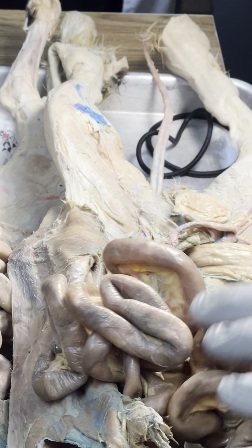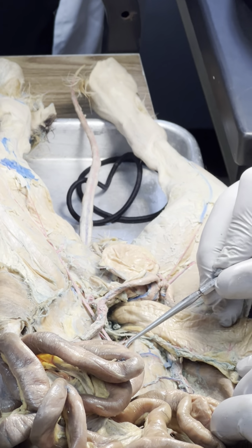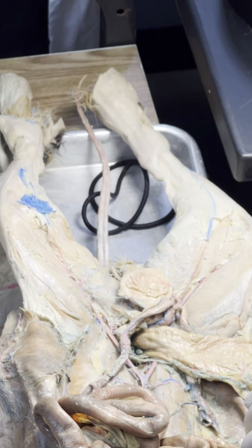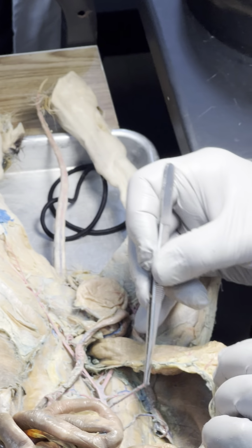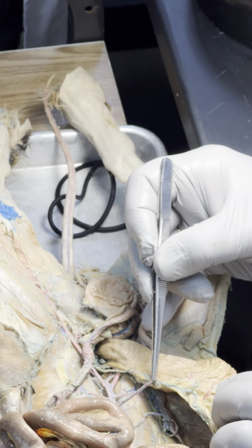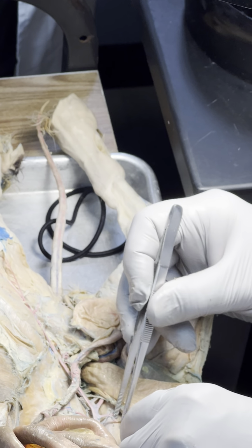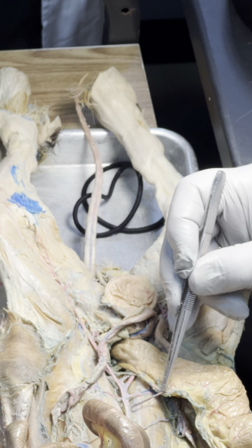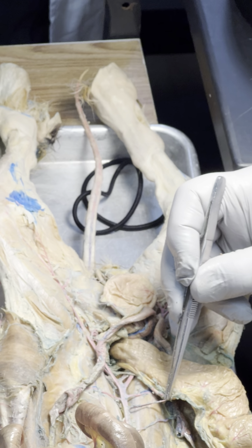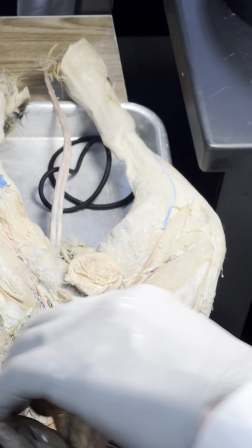If it's not broken, now it's broken. So here's mesocolon. This would have had an artery coming off of it. There it is, it broke. So that went to this. Believe it or not, last night this was not broken. So somebody used this cat today and they broke it. So if that was going to mesocolon, what is that? Inferior mesenteric. Let's continue down.